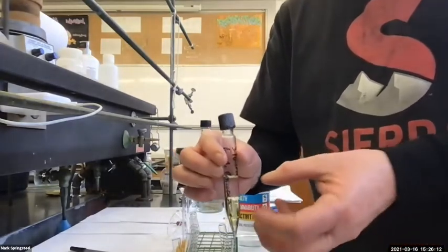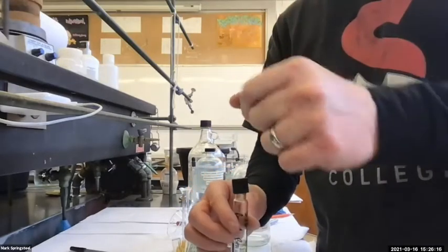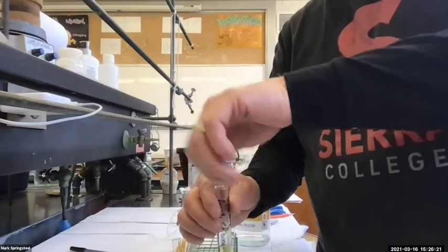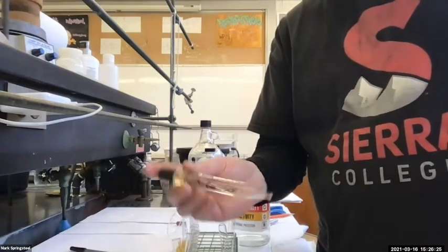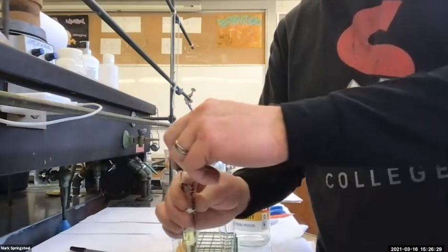And when you shake it up, you have to be careful at first, because usually it's an exothermic reaction. It can build up pressure. So if I just capped this tight and shook it a bunch, when I first open it, it might vent on me hard. So I want to cap it good. And my first little shake, I just do a tilt. And then I like to tap the cap to make sure nothing's stuck up there. And then I'll vent it.